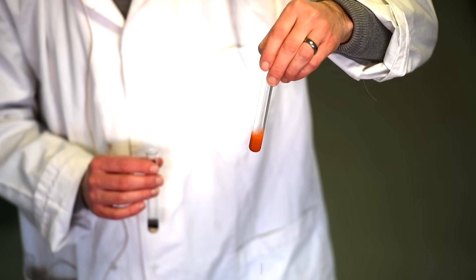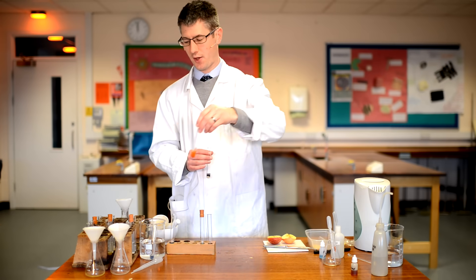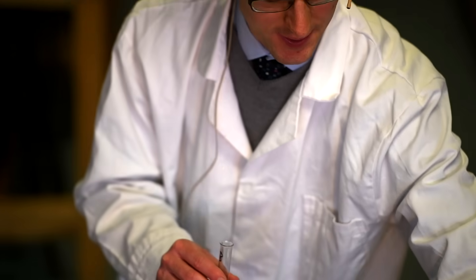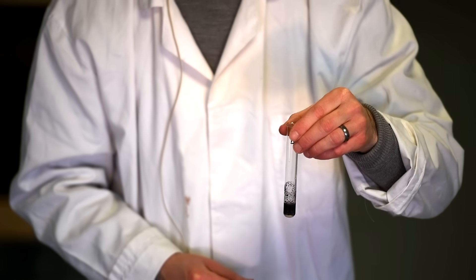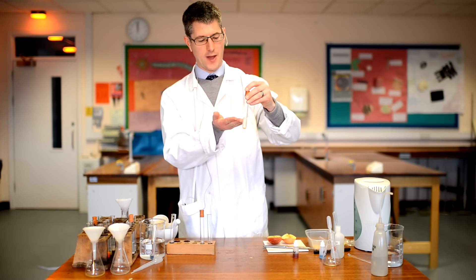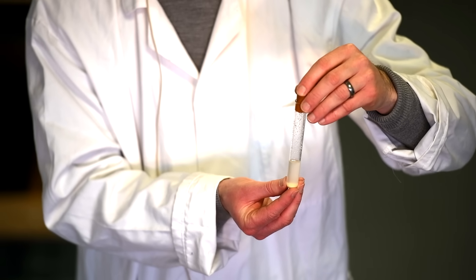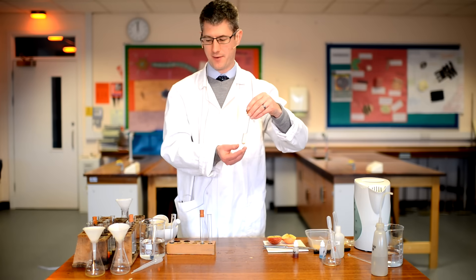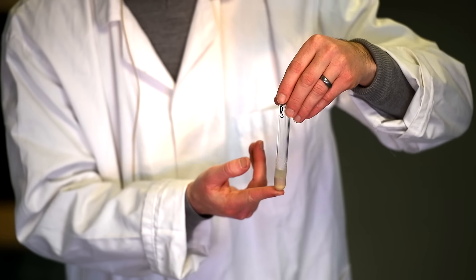Here's the sample of biscuit I prepared a little while ago. The Benedict's test has a nice orangey colour verging towards dark brick red — that's a positive for sugar, so there is glucose in biscuit. The iodine test now gives us the positive result: iodine initially started as orange and we now have a positive result of a black or blue-black colour, indicating lots of starch. The ethanol test for lipids gives us a cloudy suspension — it's gone cloudy white, which is the way you should describe this positive result for fats. And the Biuret test: not much of a change, so we haven't got a positive result for proteins in biscuit.